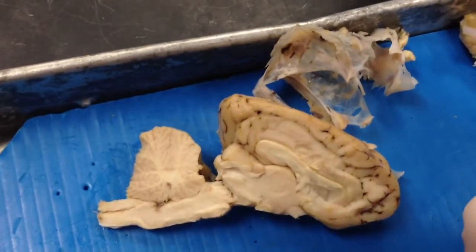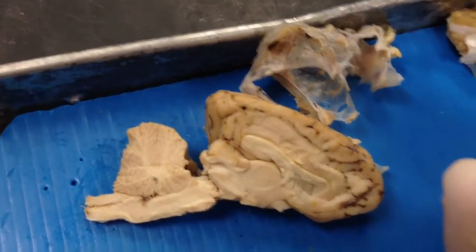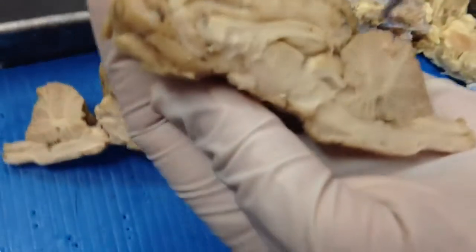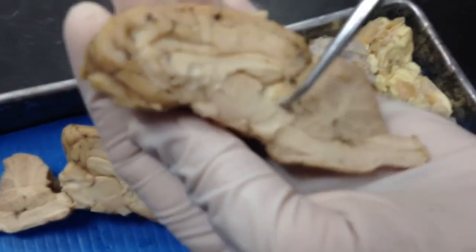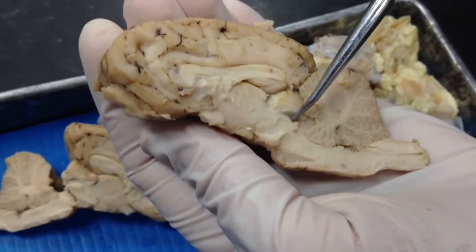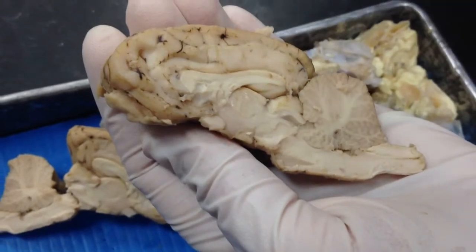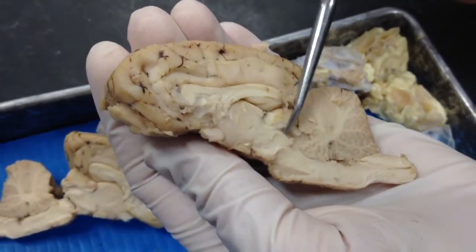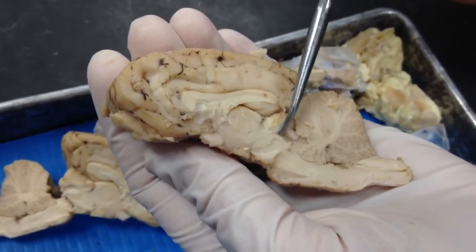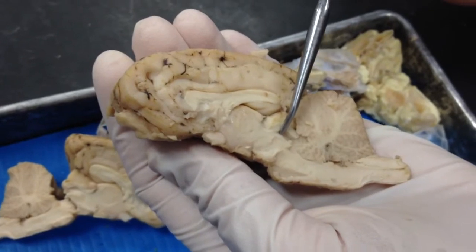The aqueduct of the midbrain is right here. That's also called the cerebral aqueduct — multiple words for the same thing.